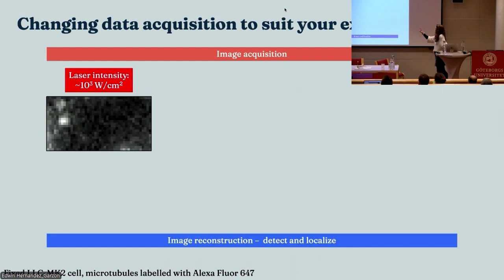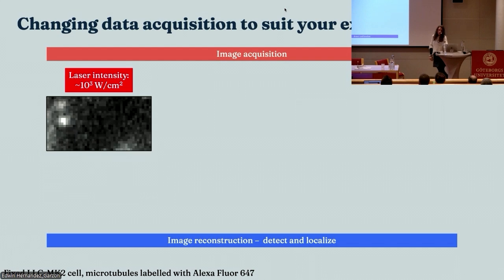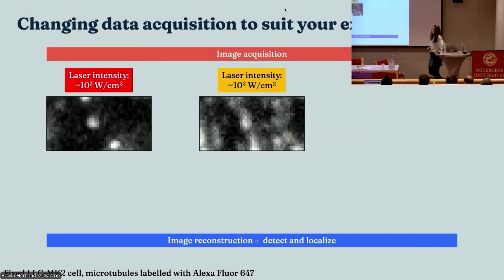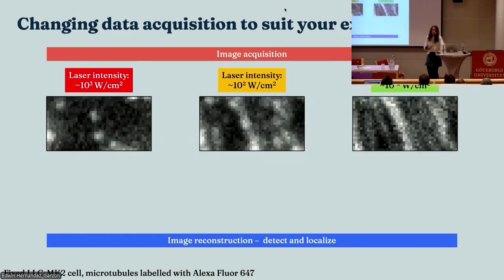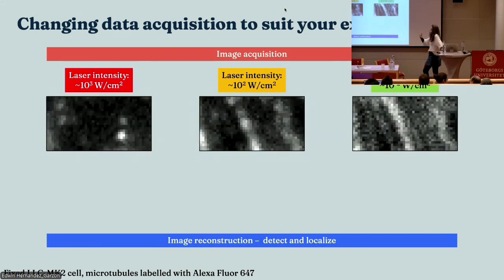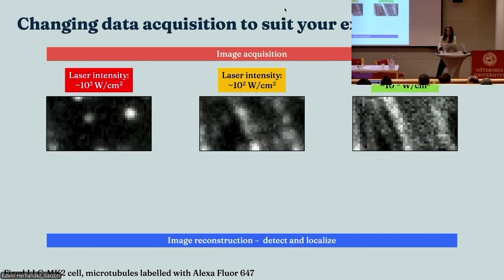And that's a classic single molecule data set, very high laser intensity, and you can clearly see the single molecules. If we want to make it slightly more live cell friendly, you might just think, let's just turn the laser down a bit. So if you turn the laser down a bit, then you see this. You lose those single molecules. If you turn the laser down a lot to make it super live cell compatible, then you see this, right? You lose the single molecules, and you just see kind of noise and random fluctuations in your fluorescence.